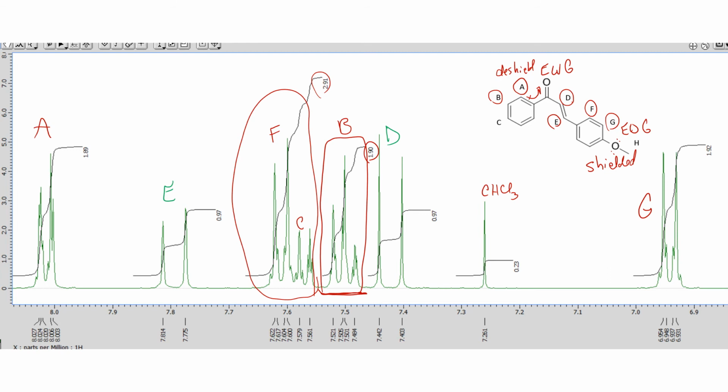One other thing I wanted to show you is, again, the lean here. Notice that A is leaning this way. And if you look at B, it's got this peak, and this peak. That triplet or doublet of doublets is leaning that way, showing that B is coupled to A. That helps us see that B and A are probably the two things coupled to each other.